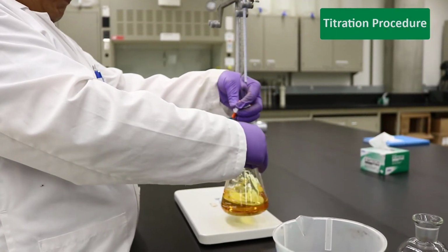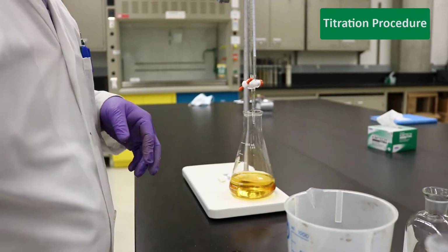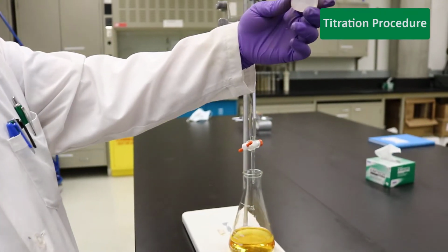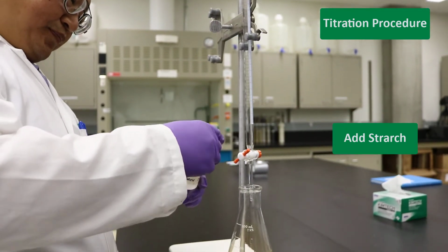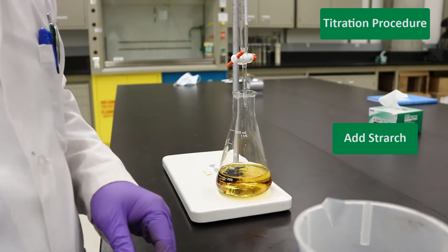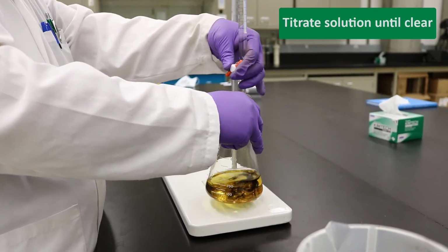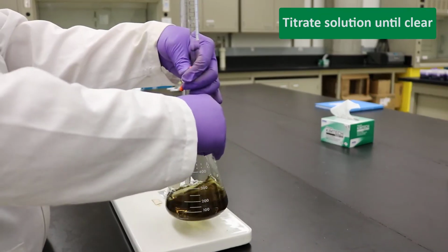Write down the initial volume reading of titrant and start titration until the color of the sample has turned light straw yellow. Add 5 drops of starch indicator. Addition of the starch indicator should cause the solution to turn blue or black. Continue titration until the colorless endpoint is reached.